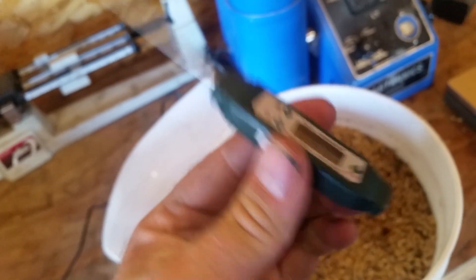Take the monitor, turn it on, stick it in the grain — and that's how you do that. You need to find the temperature of the grain to have an accurate reading. Now we'll turn our scale on and let it zero. I used to have a balance beam scale but that thing was way out — it's another thing that really doesn't like to be moved.